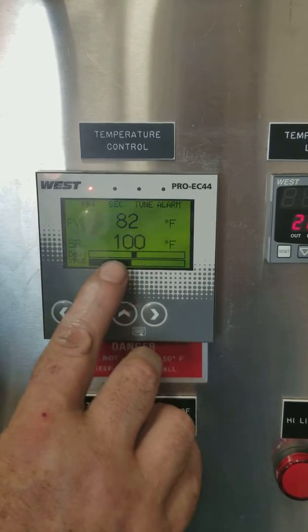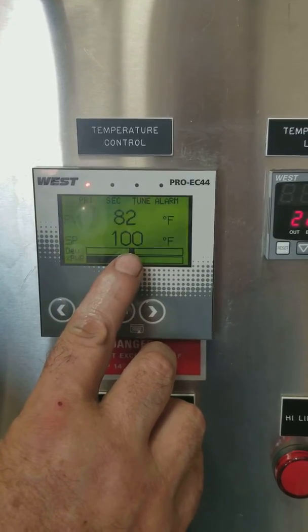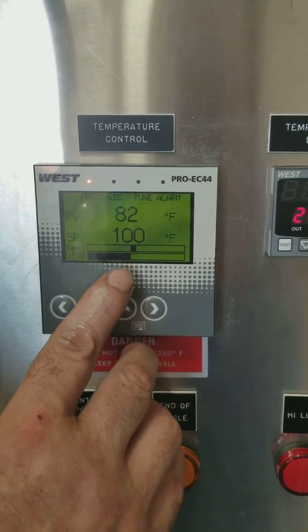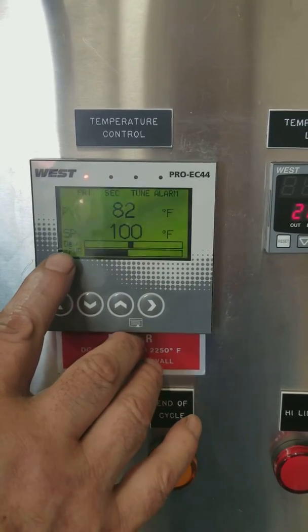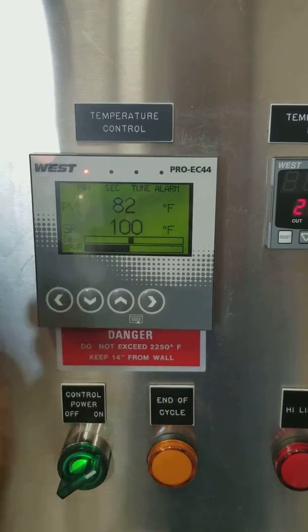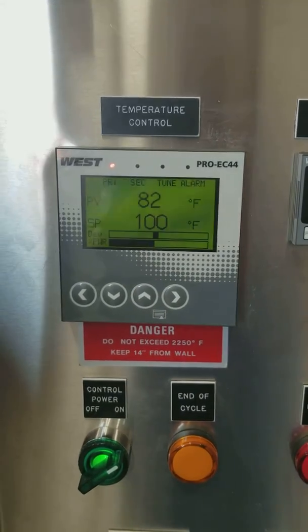You'll see your deviation bar has changed — it's saying now we're 18 degrees lower than set point. But now your power has increased because the chamber wants to heat up.